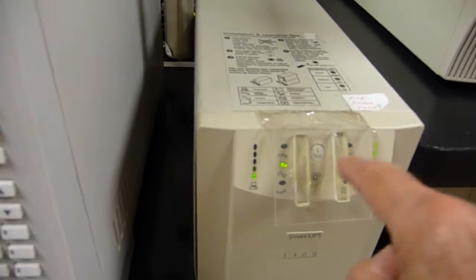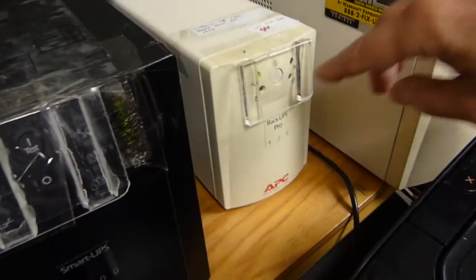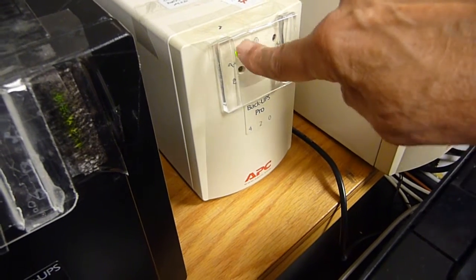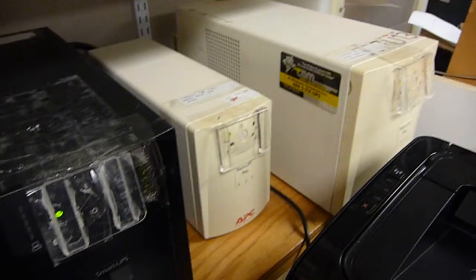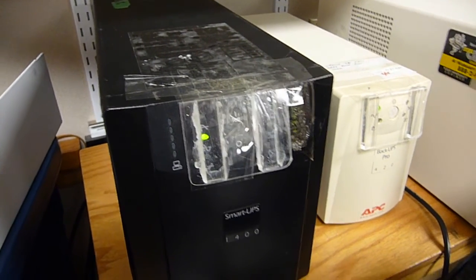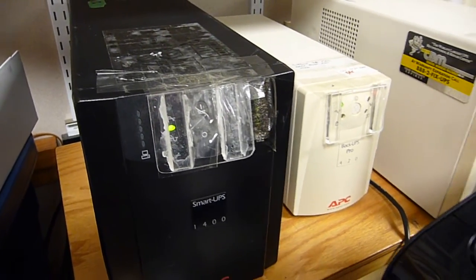So for the rough pump, it's important to have some sort of switch protection. And naturally, for this diffusion pump fan, same sort of thing. Right. And a little plexiglass. You cannot turn it off unless you remove the protection. Something I would highly, highly recommend if you go down the road of using UPSs in order to maintain instrument uptime.